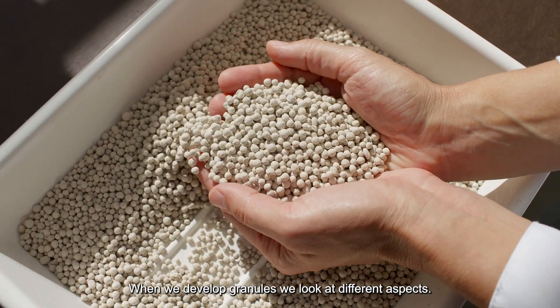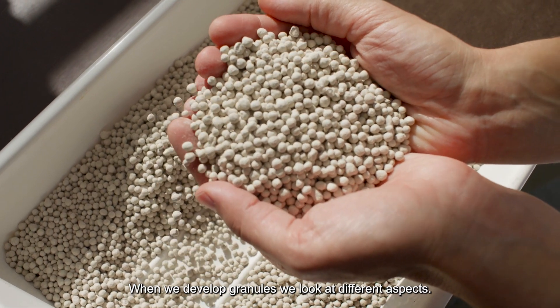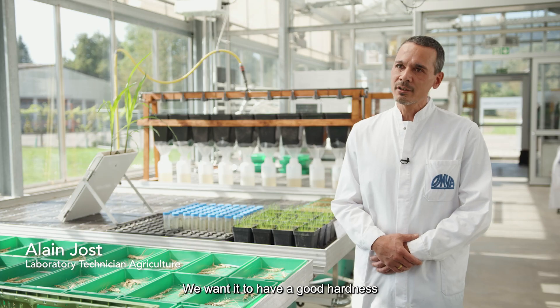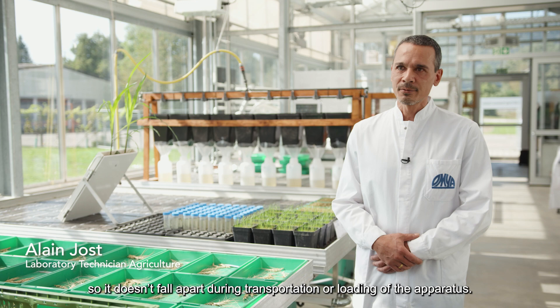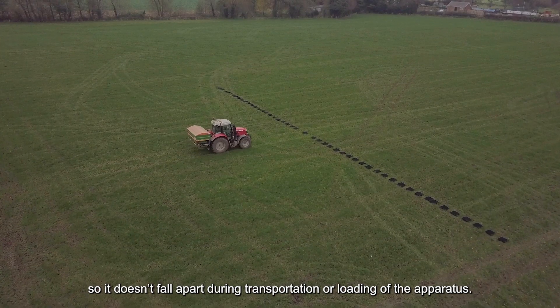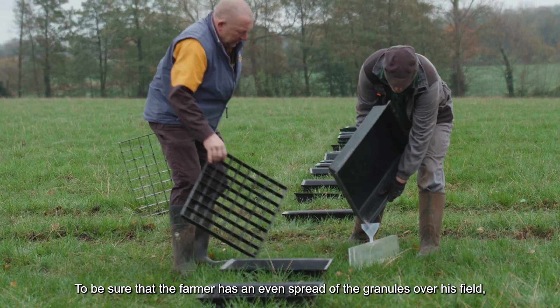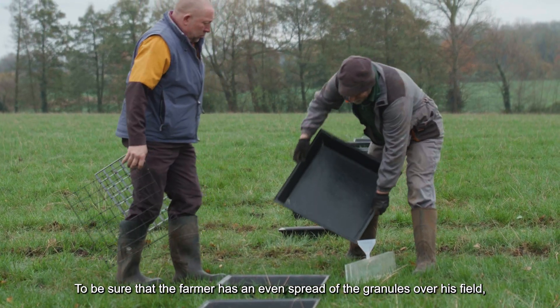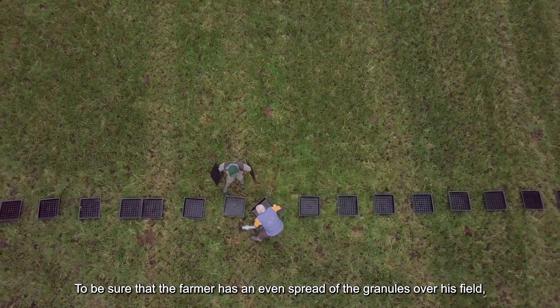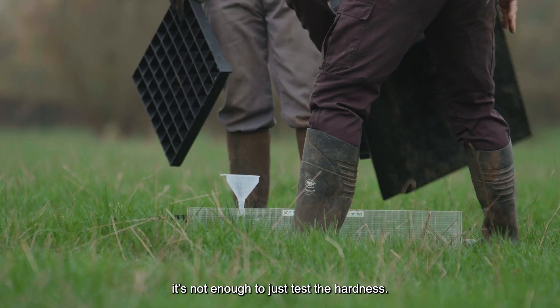When we develop granules, we look at different aspects. We want it to have a good hardness so it doesn't fall apart during transportation or the loading of the apparatus. To be sure that the farmer has an even spread of the granules over his field, it's not enough to just test the hardness.